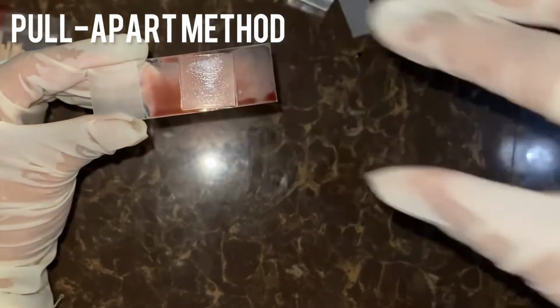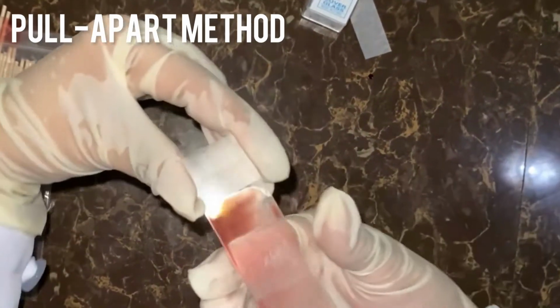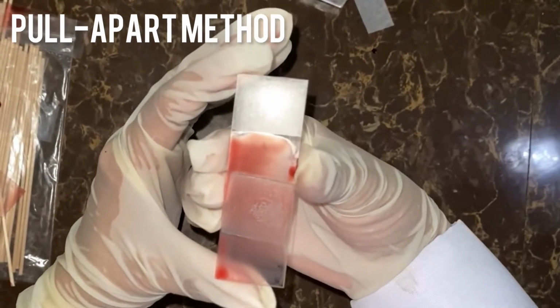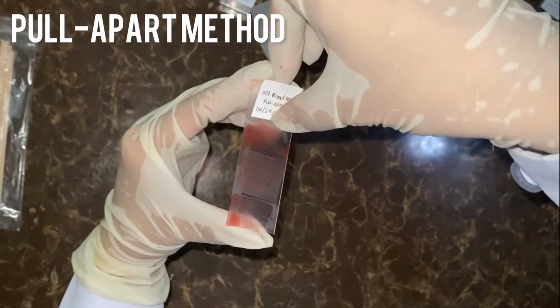Cover the smear with a cover slip. Fourth, label the slides.